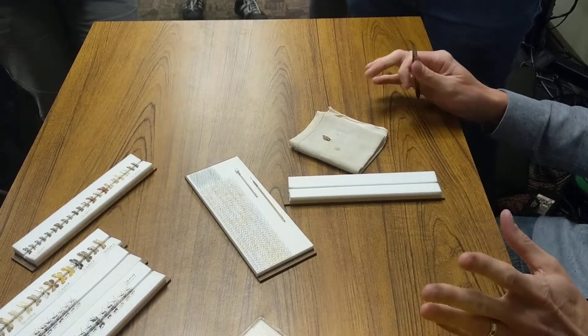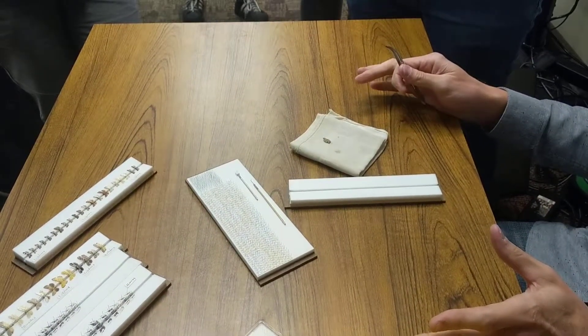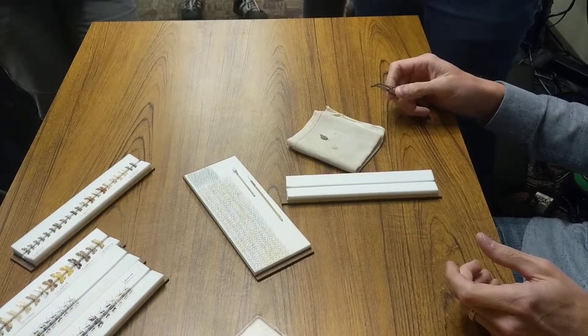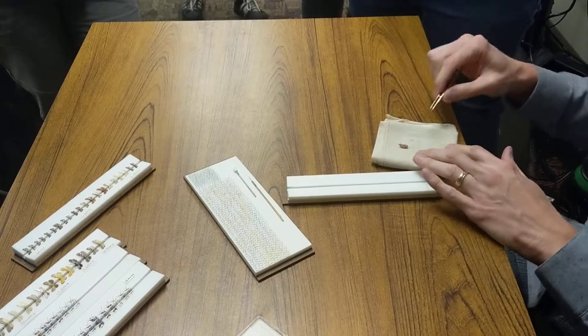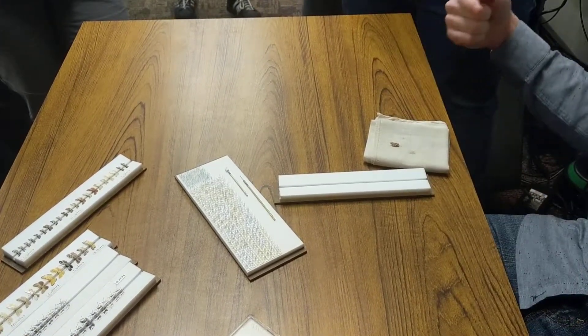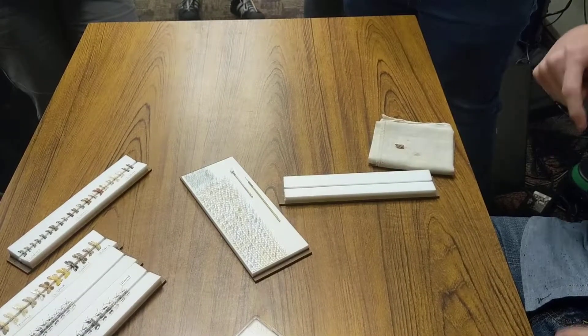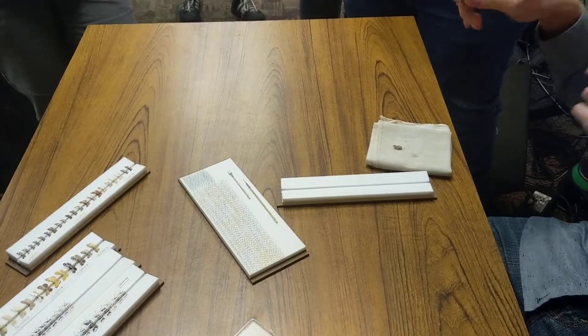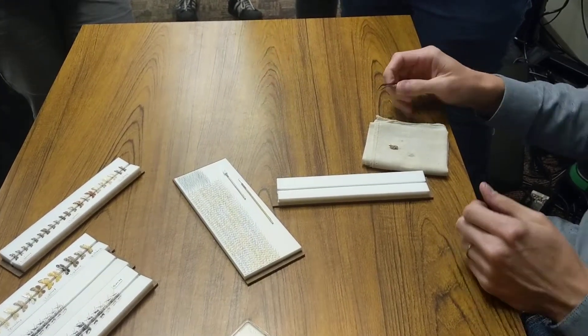If you do that, it'll be much easier to spread. That's why it's useful to have some sort of magnification, especially on small stuff if you can't see. Because if you just randomly stick the pin in, it might be going through the wing or the head or the abdomen. If it's through the wing, you're not going to be able to spread the wing up.